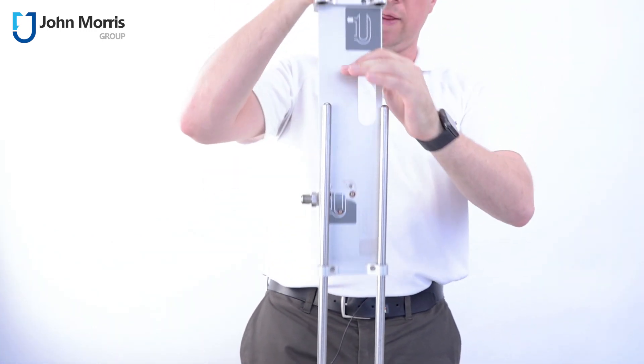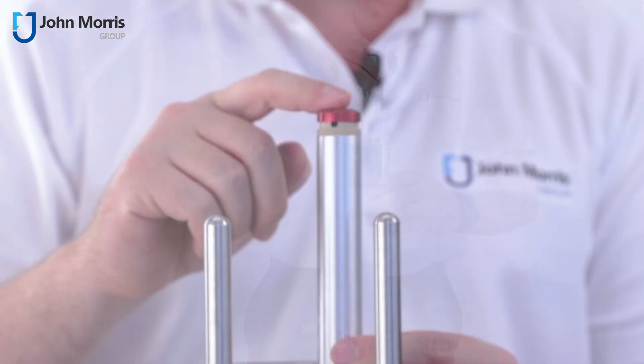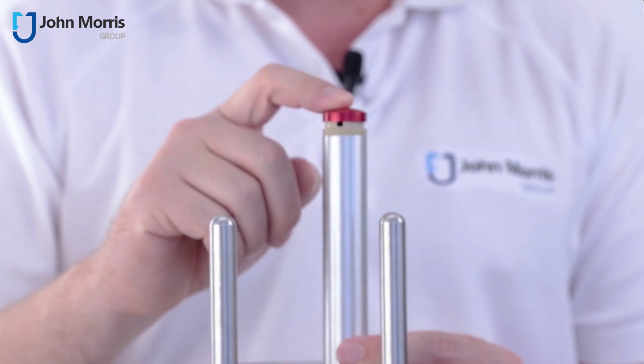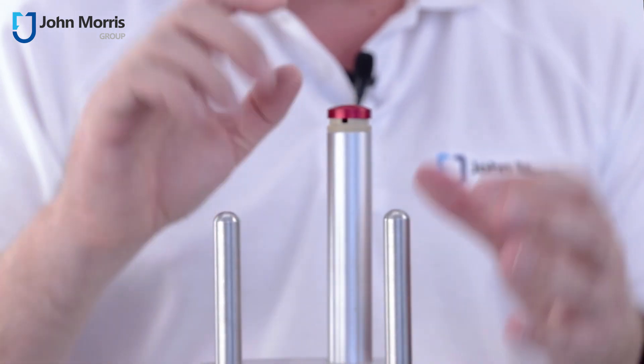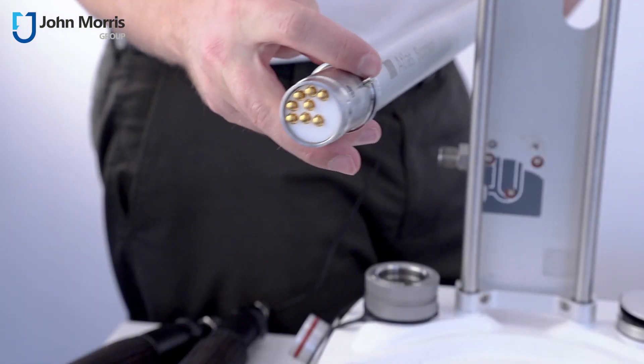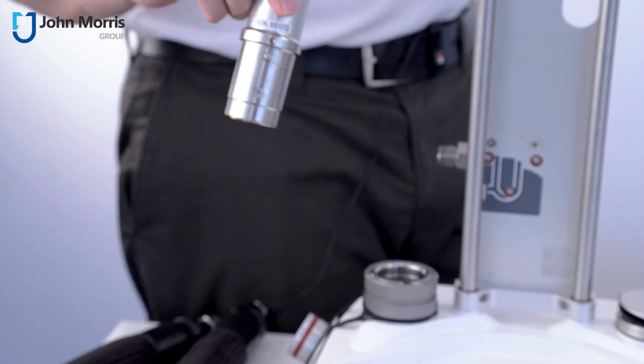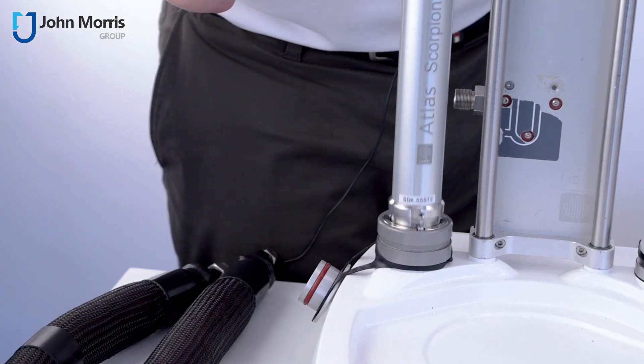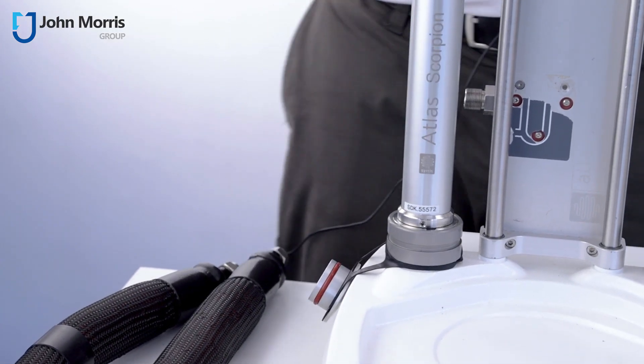It slips on just like that. Important point to mention right up here at the top, when you push this down this will essentially drain the fluid out of your jacket. The Scorpion enables you to control an overhead stirrer and it just clicks straight into place like that.